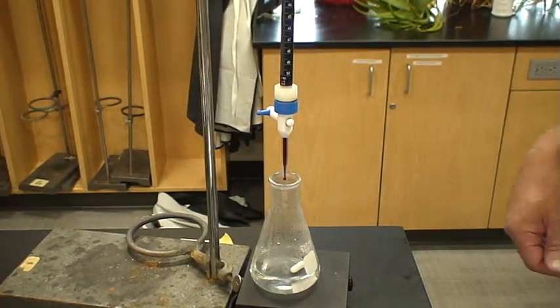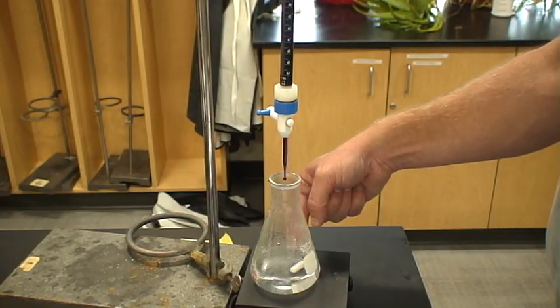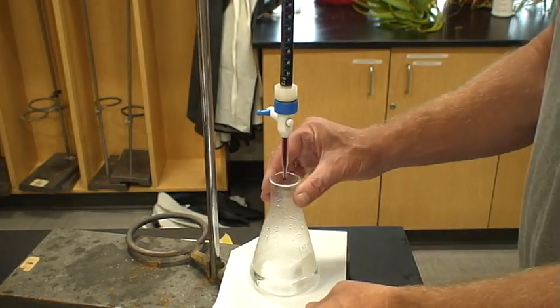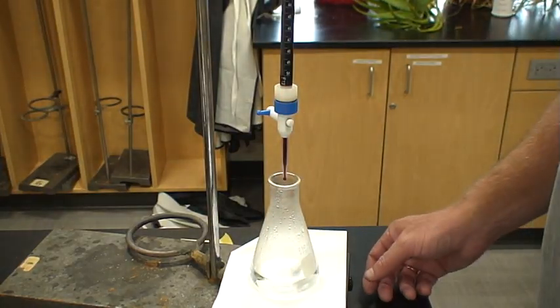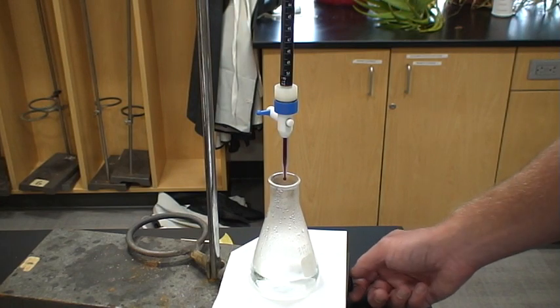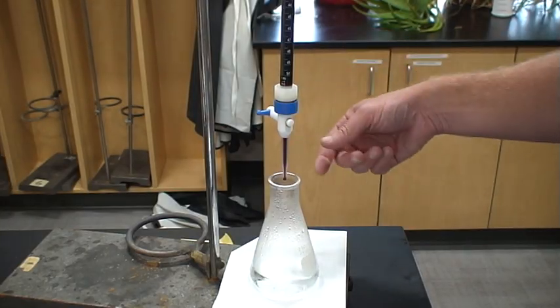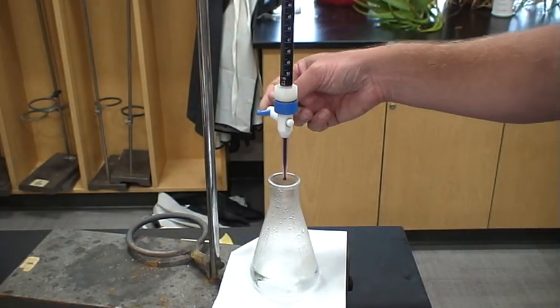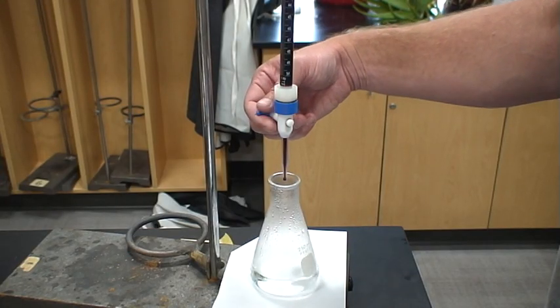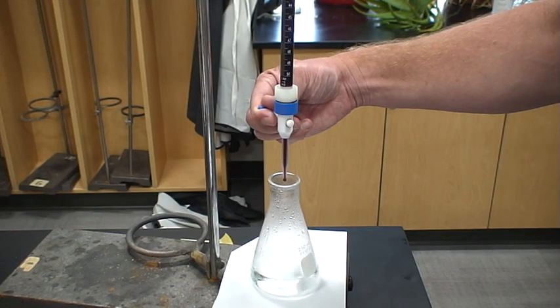Now, I said that we were going to be looking to see the color pink. So it's really hard to see the pink through the black, so I cheat by taking a sheet of white paper and I put it underneath. That way I'll be able to see when it stays pink. So now I'm going to turn on my magnetic stirrer. Okay, that's going to make sure that any of this solution will be dispersed evenly throughout, and I just make this go parallel with my burette, and I'm just going to add just a little bit at a time.